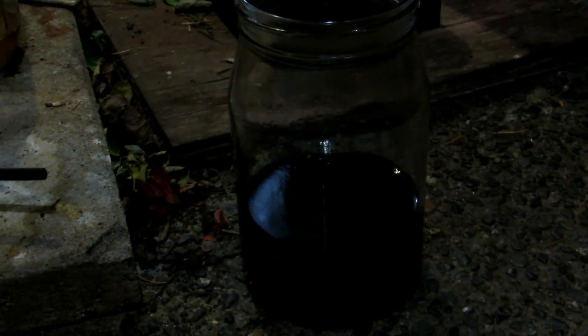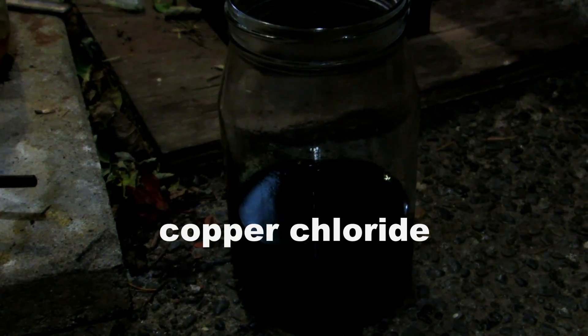I just wanted to quickly note how much this reaction has ramped up. You can see through the top but not the bottom — this is because our solution is extremely concentrated at the bottom and it's all sinking down. There's also a vigorous amount of bubbles being formed. A look from above might show it better. There are a fair amount of bubbles being produced, which means the reaction is proceeding fairly quickly. Swirl it around to mix everything and continue letting it sit.